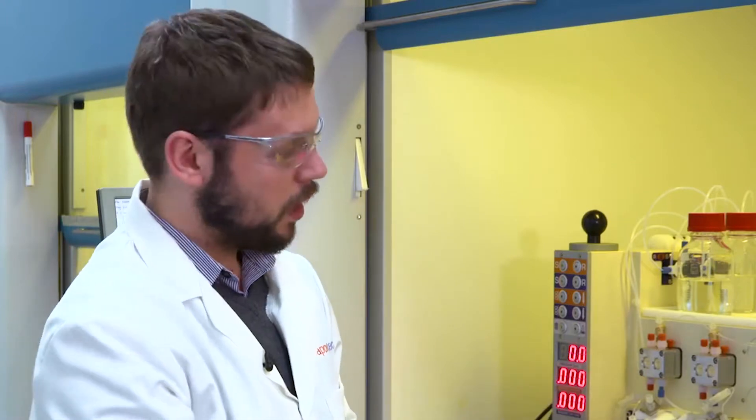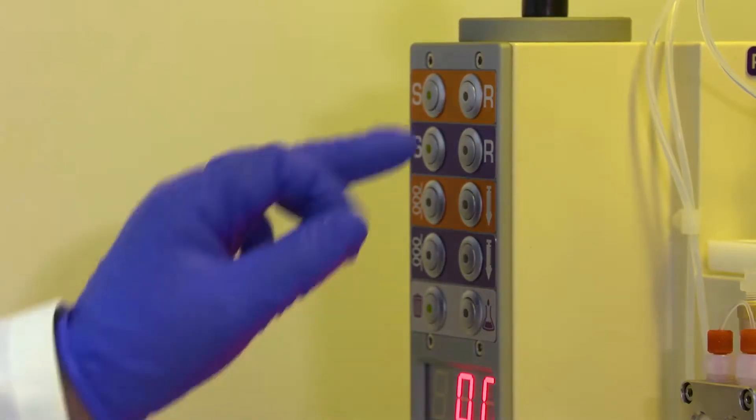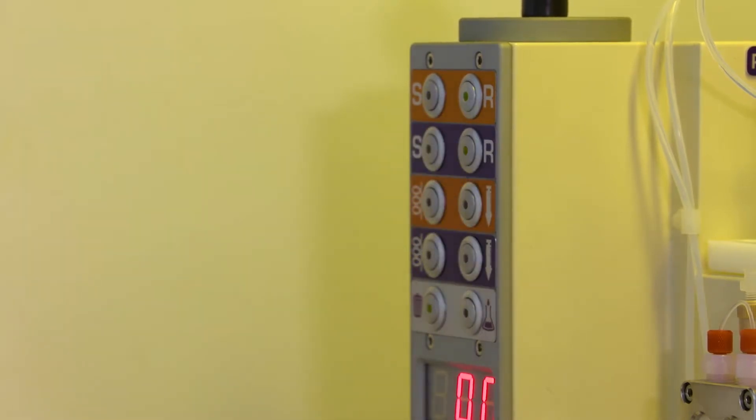So now the pumps have got the right solvents I can prime my reagents as well. To prime the reagents first I need to put the switching valves into the reagent positions.